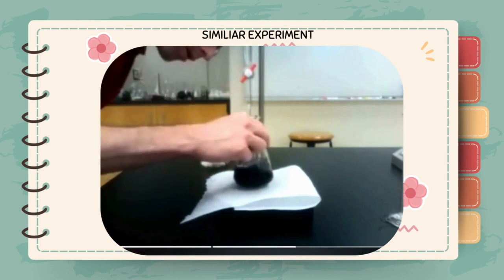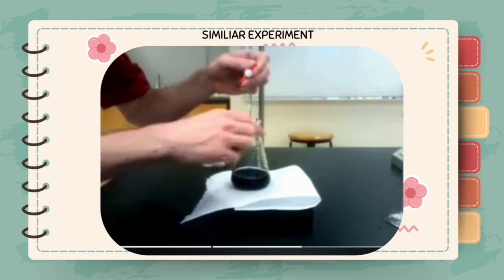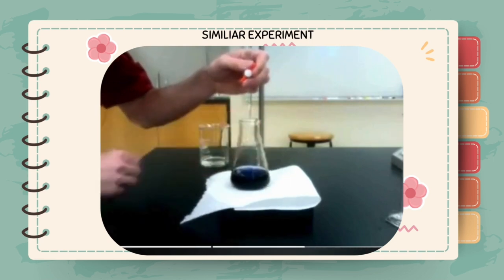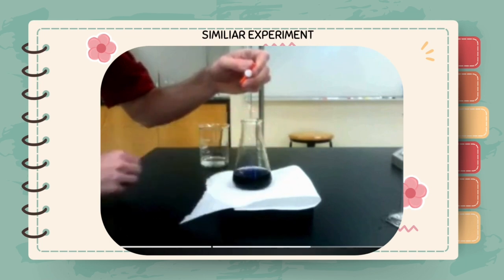As with all titrations, it is important to swirl the flask continuously to ensure that the reaction is proceeding. In addition, rinse down the walls of the flask on occasion to make sure that no reagent or titrant is clinging to the walls.